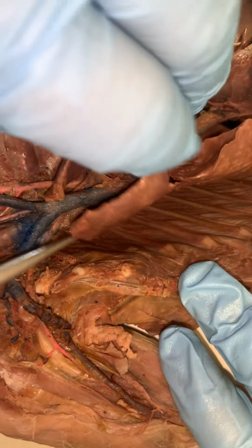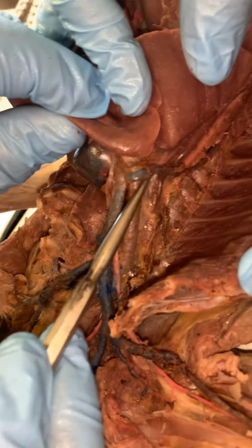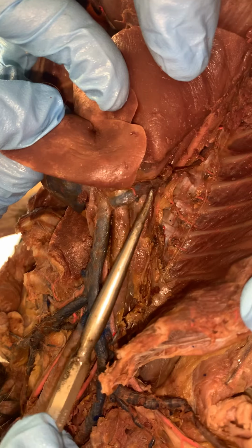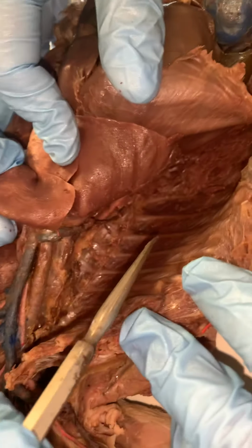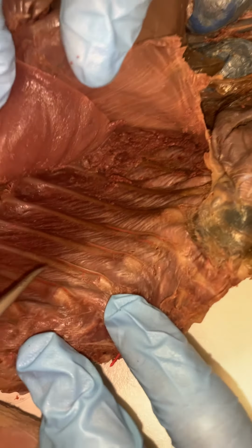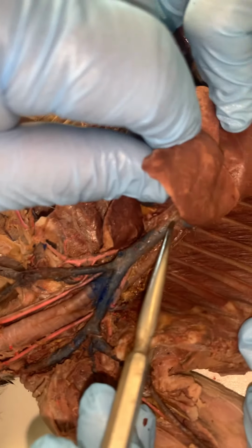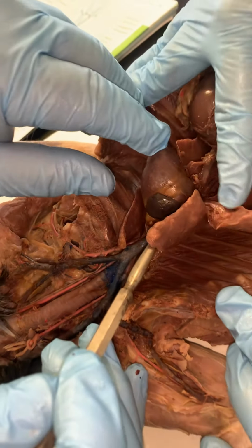If we rotate this on the back side, you can see another vein right here called the azygous vein. This will basically drain all the structures of the thoracic cavity. It extends further down, but it's going to drain, as I said, all the structures of the thoracic cavity. So you have a series of intercostal veins that will dump into the azygous, and it will then return and dump into this superior vena cava and drain those structures.